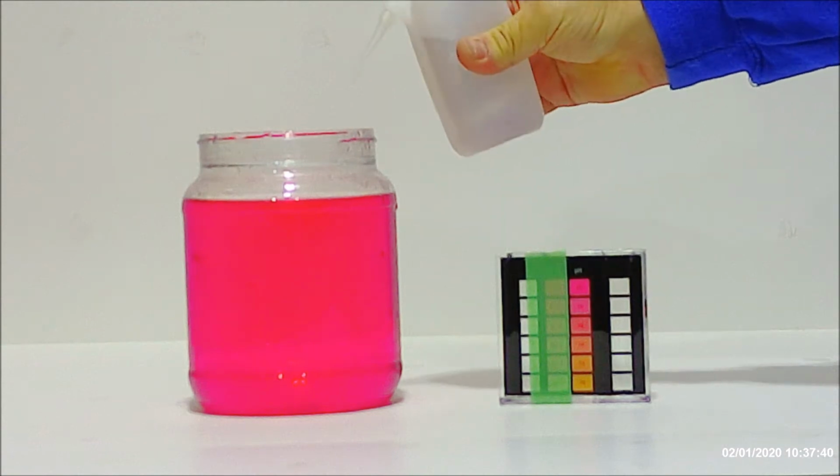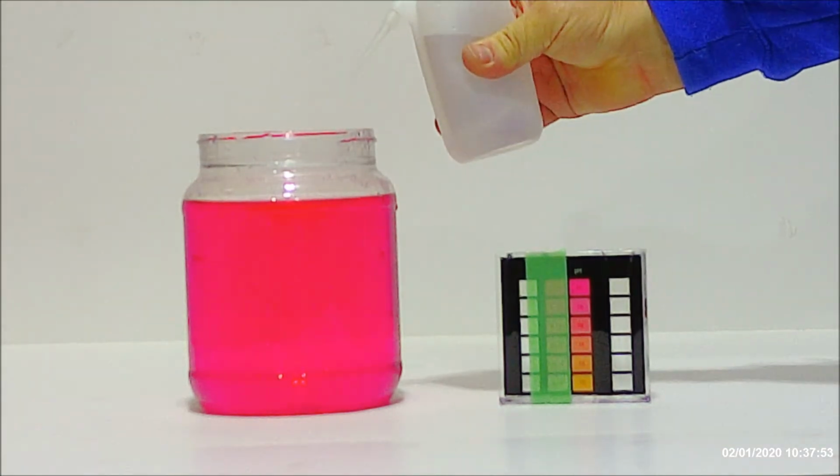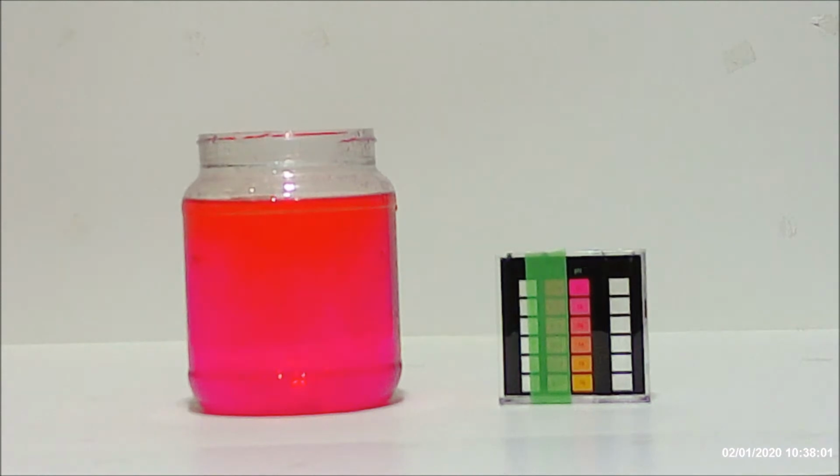Unfortunately, my bottle is a little defective, so it's taking longer than what I expected. However, the next little adjustment there, we'll have some pH minus going into the water. And what we want to do is drop our pH down to the yellow part of our spectrum on the color comparator, because that's going to give us a very low pH.